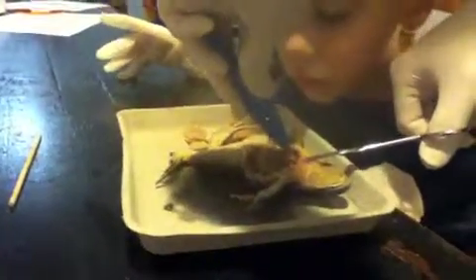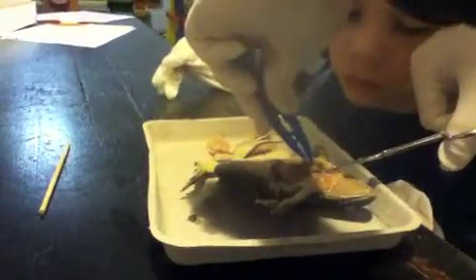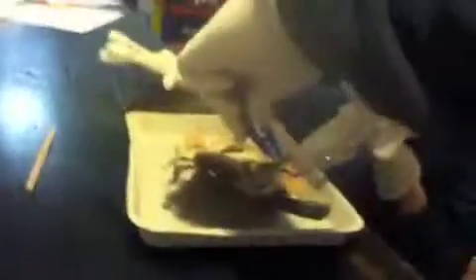Look at your sunglasses. Cameron's very interested. He's fascinated. Harry, you're so good at dissecting. My favorite are those little fatty bodies down there.